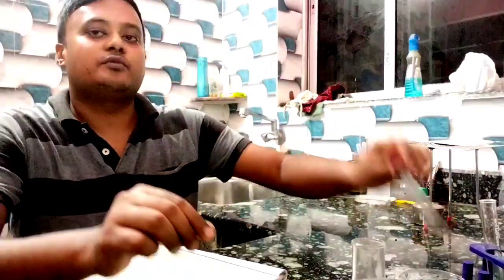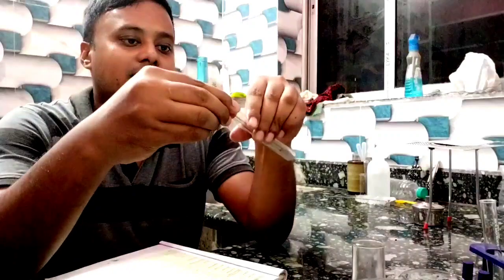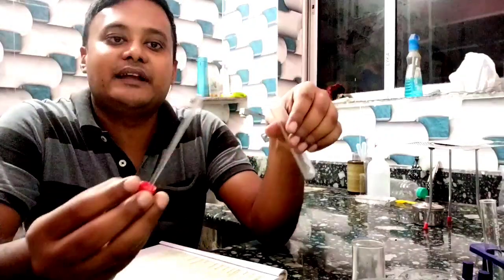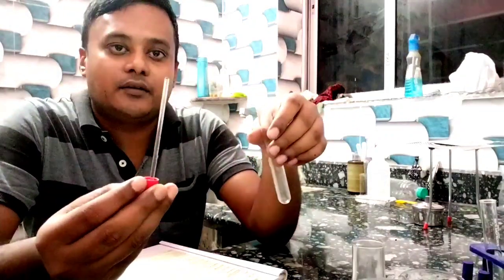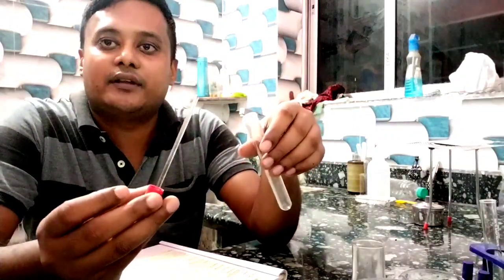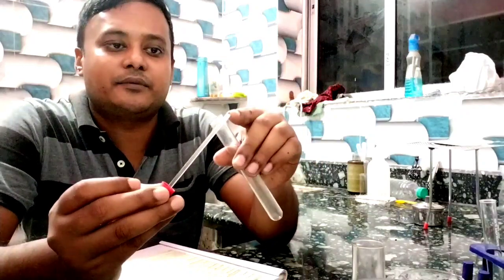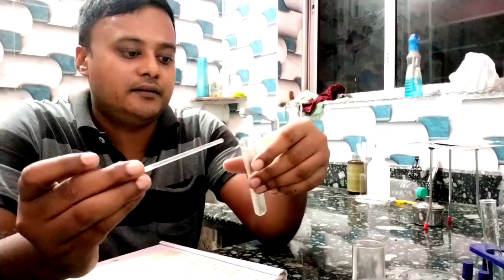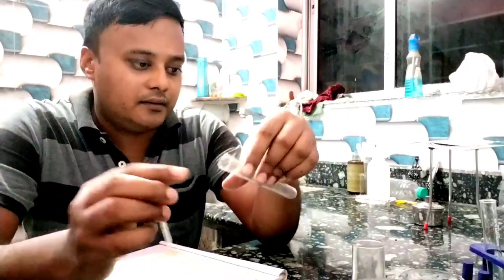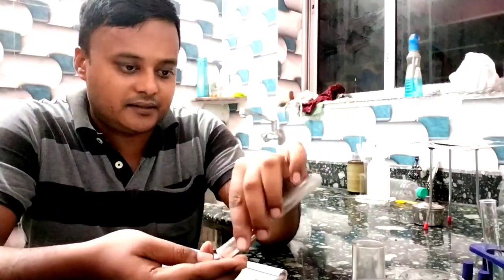Next one: platinum wire, used for the flame test. The fine platinum wire is at the tip. It appears to be slightly broken.